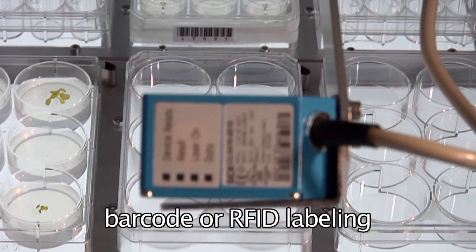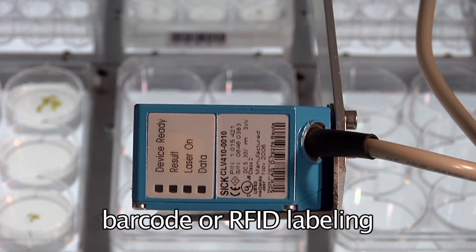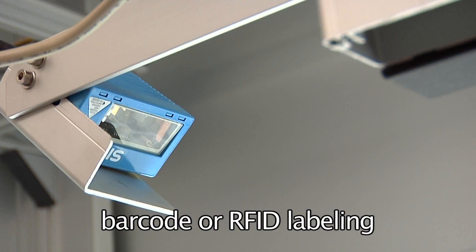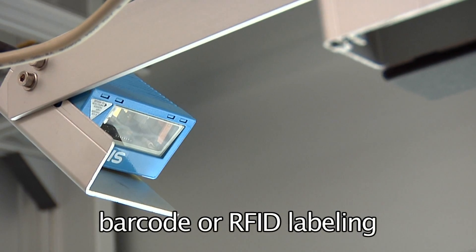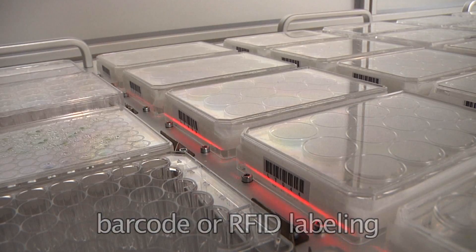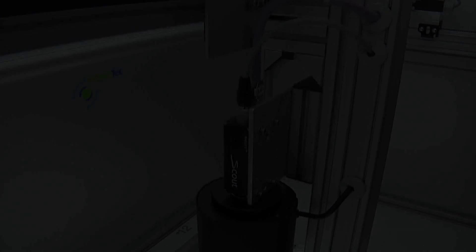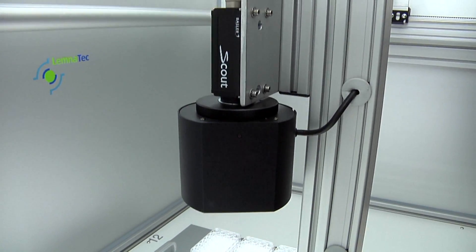Samples are identified by their barcodes and position within microtiter plates or trays. Each well or sub-vessel is analyzed individually and the results can be correlated to experimental data.